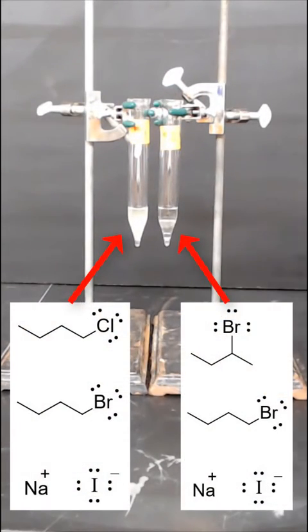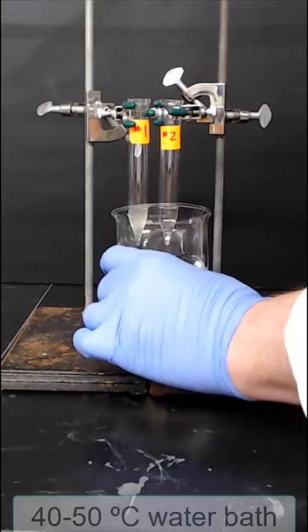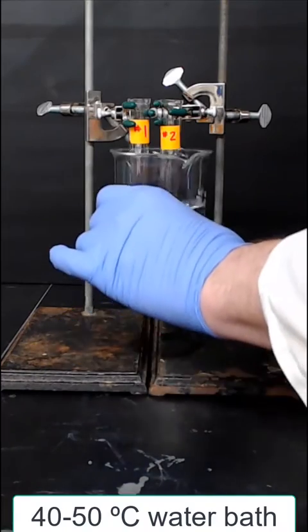Here's a summary of the various reagents that are present in each one of the reaction tubes. Next, we'll heat the reaction with a water bath at 40 to 50 degrees Celsius.